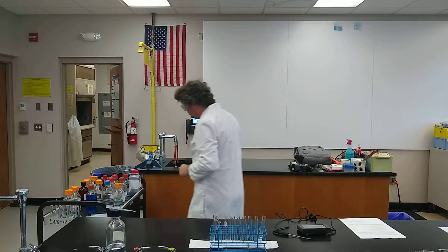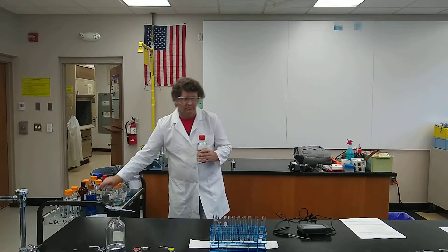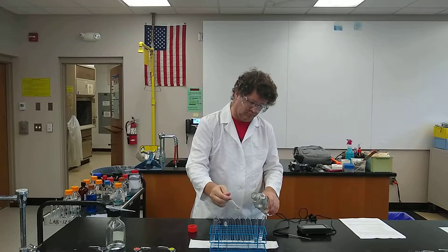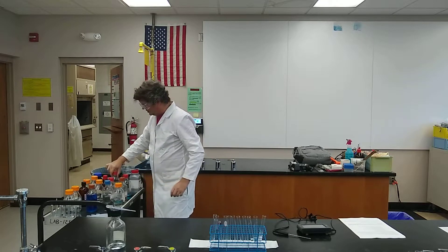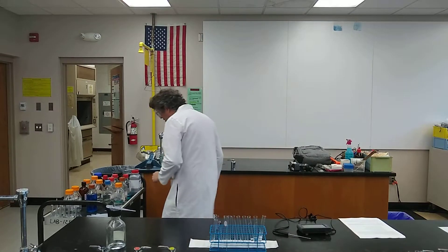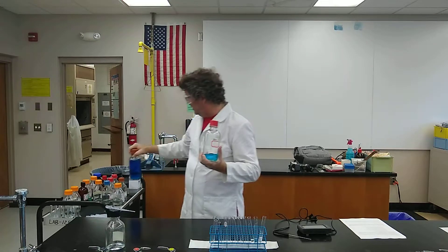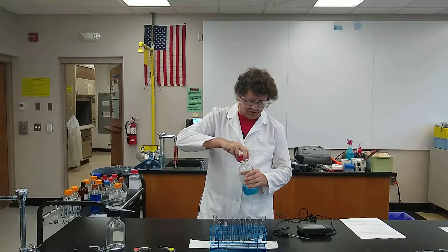Number three is sodium phosphate. Along with sodium phosphate, we are putting in copper sulfate — a pretty blue solution. When you get to the lab, there is one molar copper sulfate in here as well, which is a noticeably darker color. We want the lesser concentration one. If you mix the wrong one, you just won't get the noticeable results you're looking for.